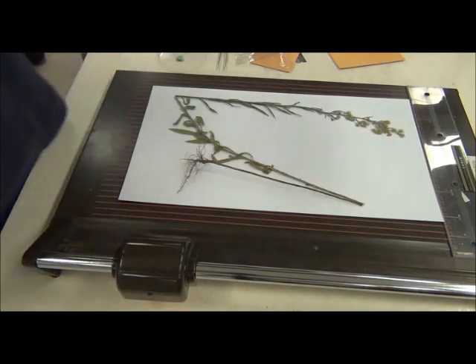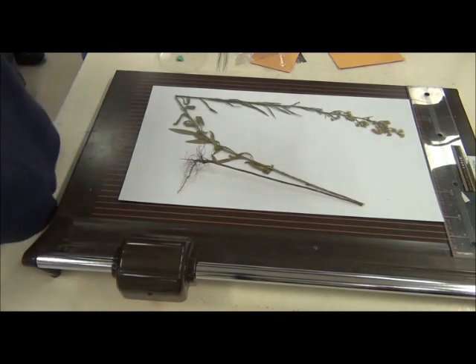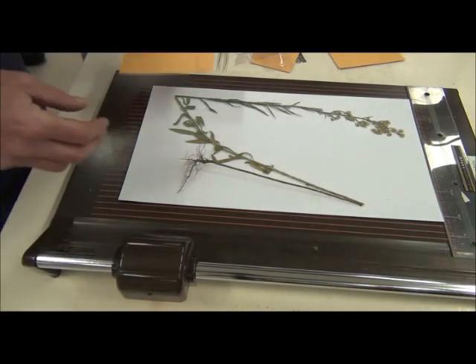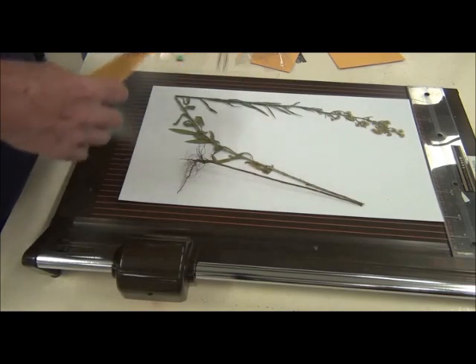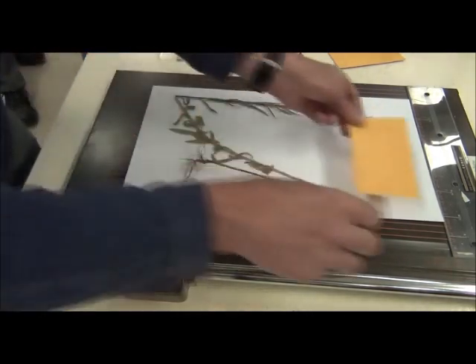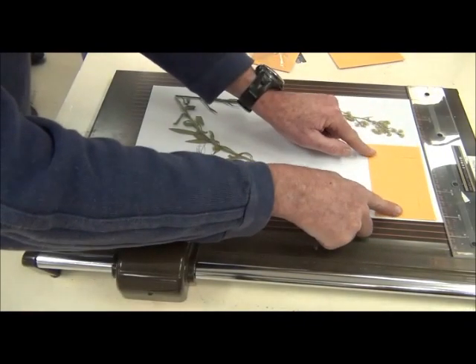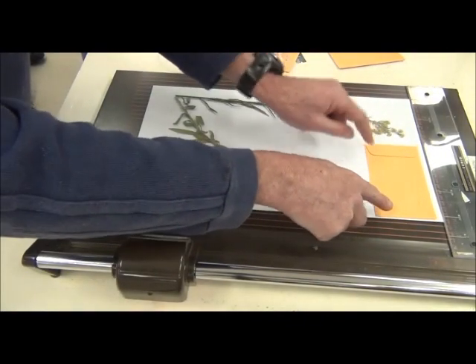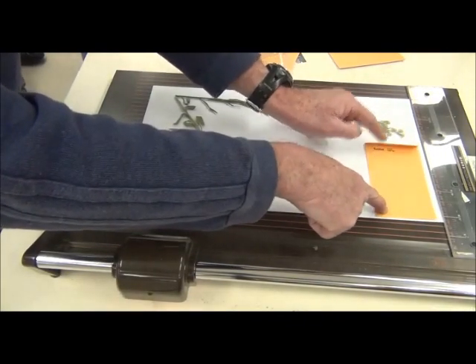It can be slipped into the bag but before you slip it in, again, you need to stick down the bag. There's no golden rule as to where the bag goes. In this case, it's sort of obvious that it can go there. I can put that there and notice I'm putting the opening bit there so it's inside. It wouldn't be a disaster if it went the other way around.